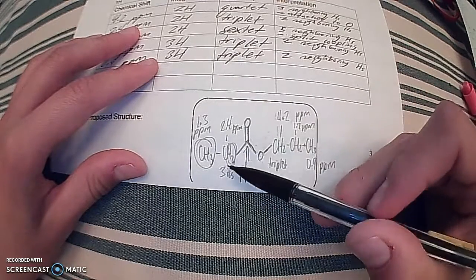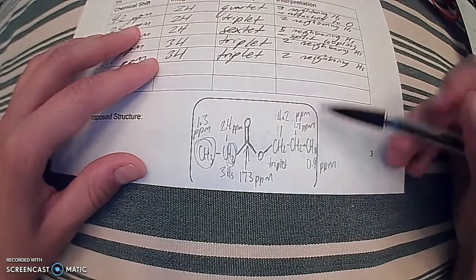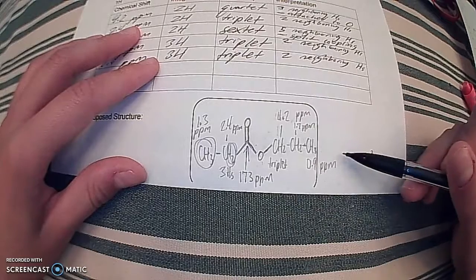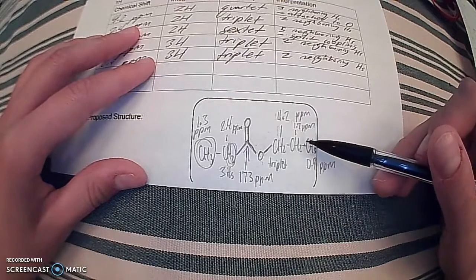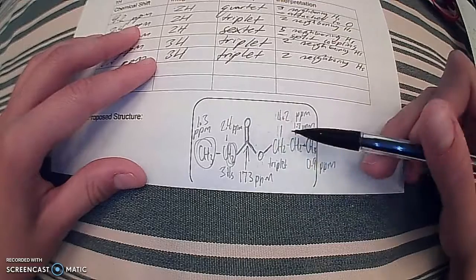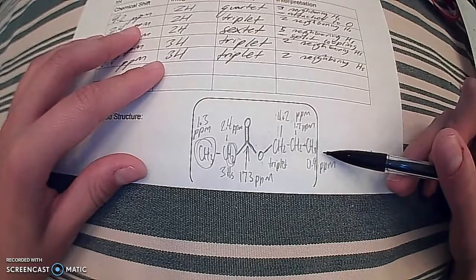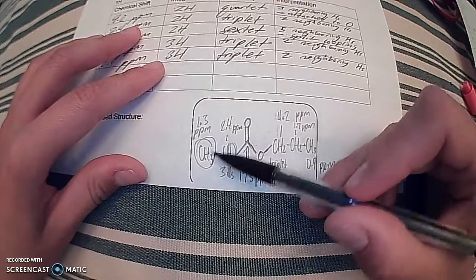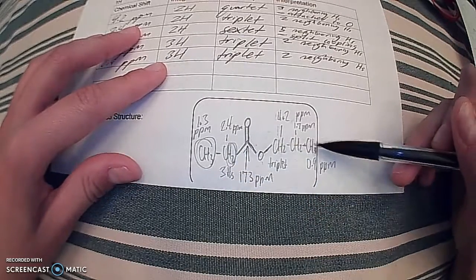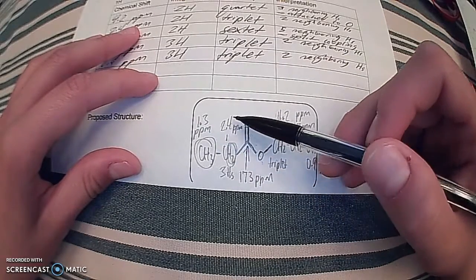The reason why we know that this methyl group is in this location and not over here is because this methyl group has a 0.9 parts per million, meaning it is farther away from, let's call it, all of the action. So all the action is going down here. It has a lower parts per million, shifting more upfield. And down here, this is only removed one other carbon over, where this is removed a couple. So that's going to be our slightly higher parts per million at 1.3.